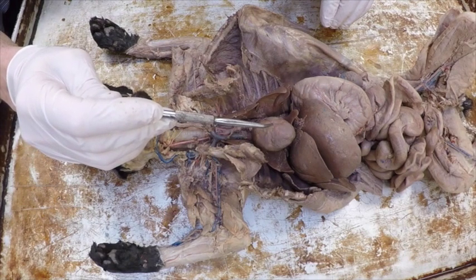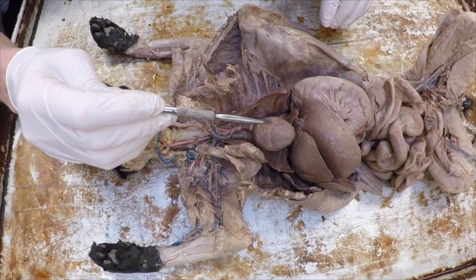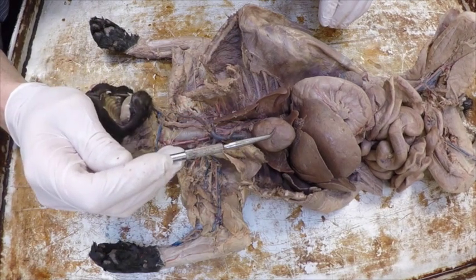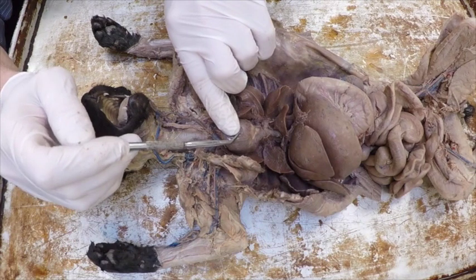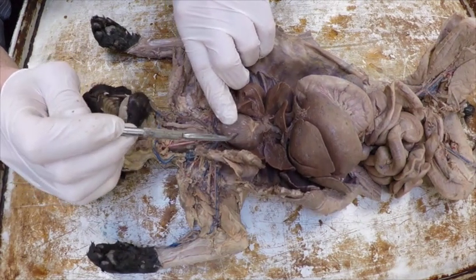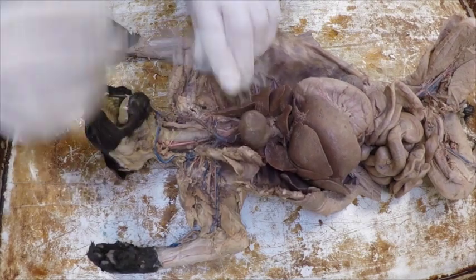Most hearts won't have the arteries and veins injected on the heart, but this one happens to show it. These actually feed the heart. This is my coronary artery, and right next to it, the blue one, is my coronary vein. On the back side of the heart, if they inject, you can see a cardiac artery, and you have a cardiac vein, which would be in blue, and I'm not sure that's visible.